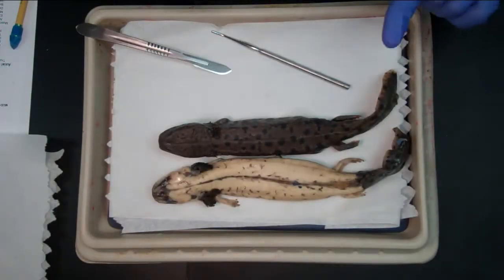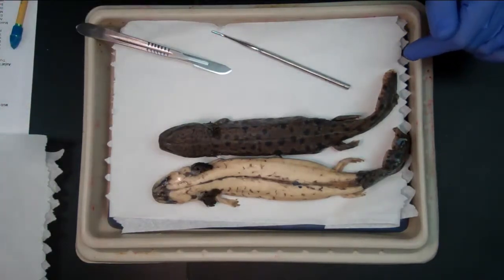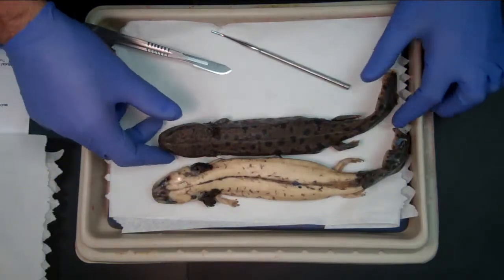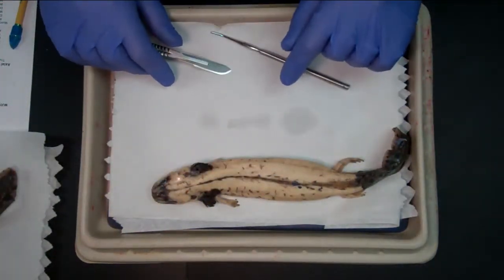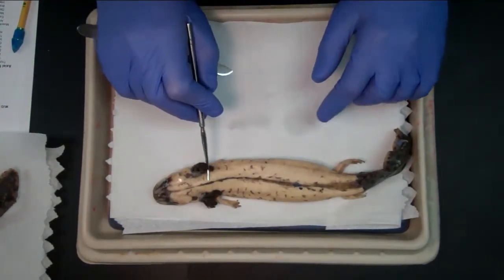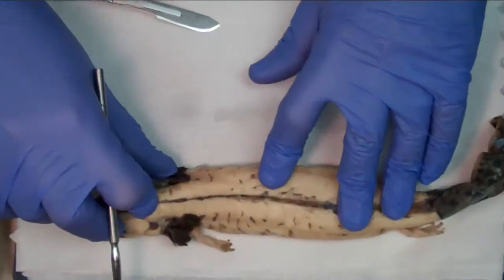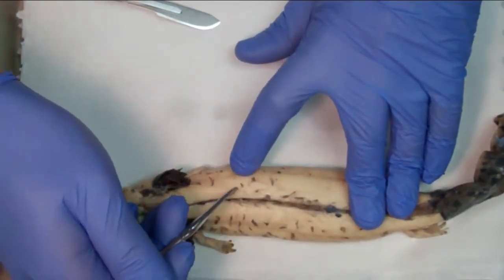So we're going to start here with the mud puppy. I have the one that has the skin on and the one where I removed the skin. I'm going to put this one to the side so we can focus on this guy. And one thing that you notice about the mud puppy is that, much like the shark we dissected, it's very segmented. I don't know if the video will be able to show the details of it, but there are segments of muscles throughout the entire extension of the mud puppy.